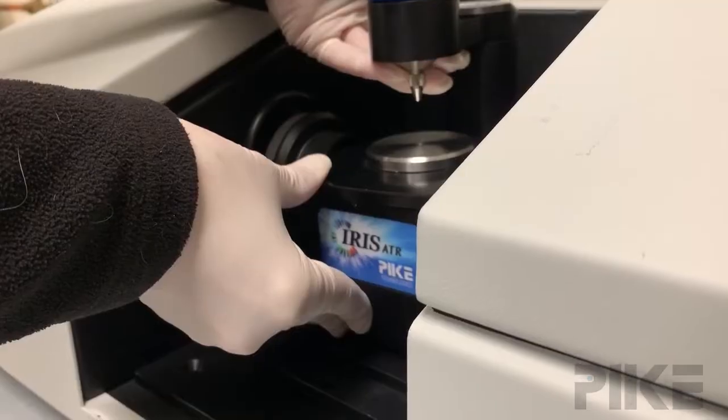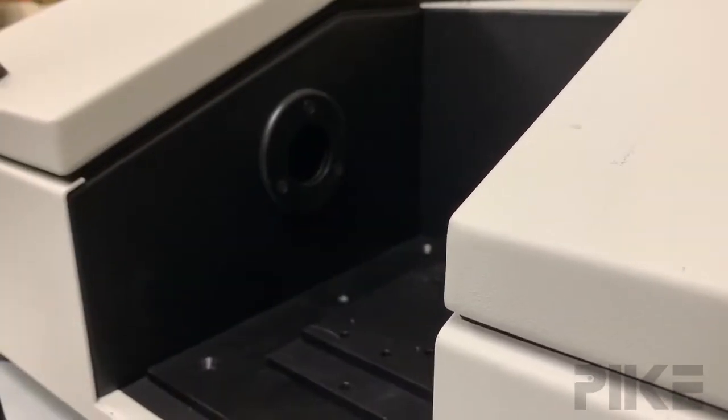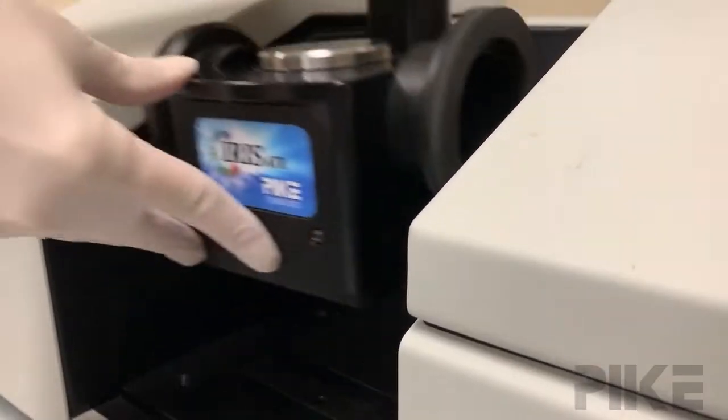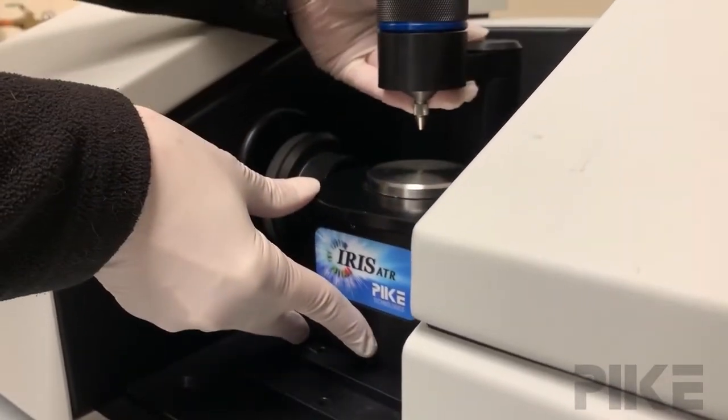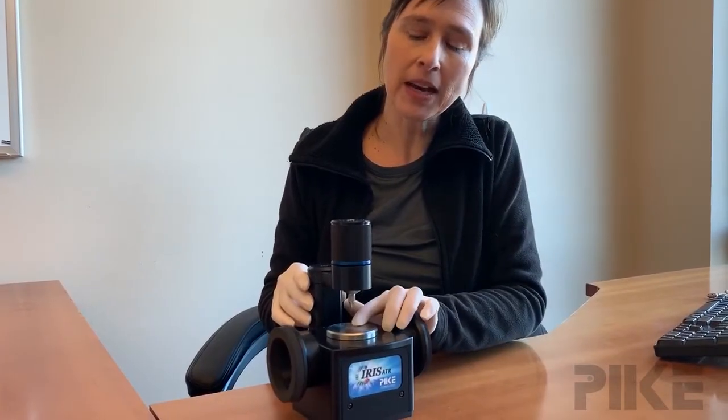What you do is remove your ATR from your sample compartment and collect the background. Then insert your ATR and collect a sample spectrum on a clean dry crystal. This will give you the amount of energy ratioed against an open beam, and from that we can gauge a lot from the spectrum.